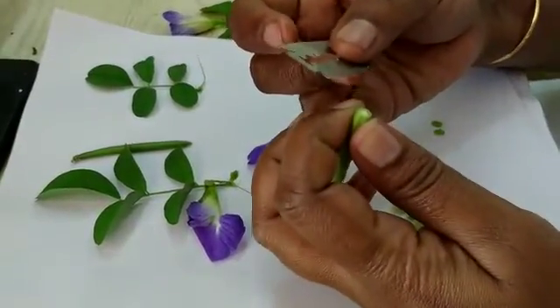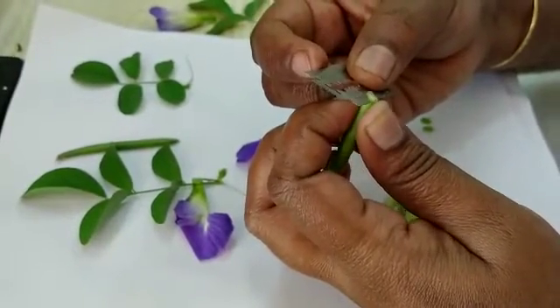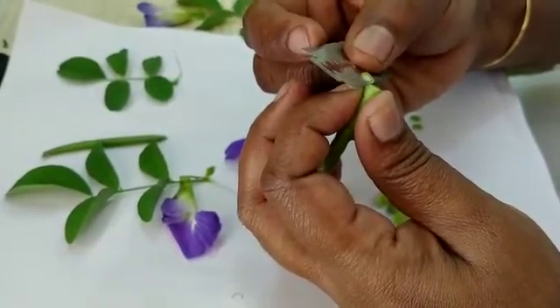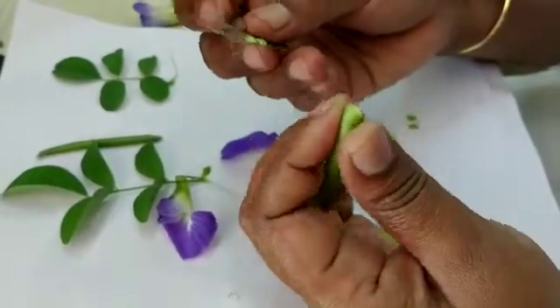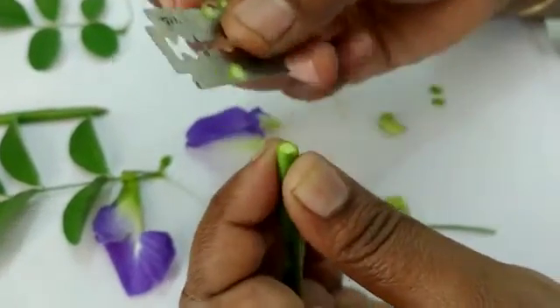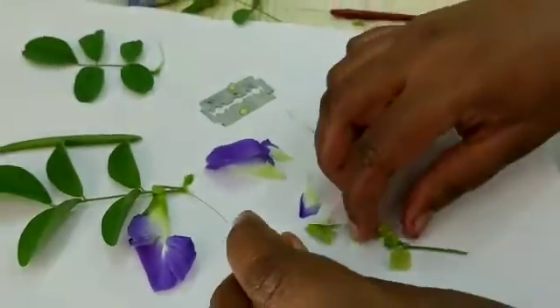Instead of the ovary, I have taken the fruit — this is green gram. In this you can see a single ovule inside the locule. You can take several sections like this. One ovule is present inside the locule, and you can see the placenta nicely.